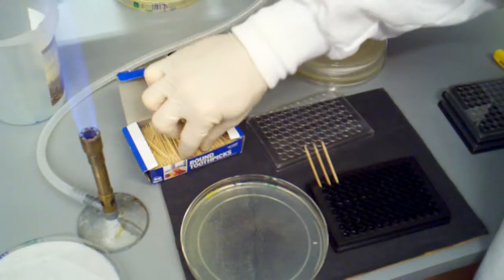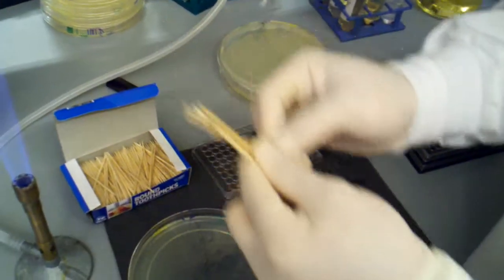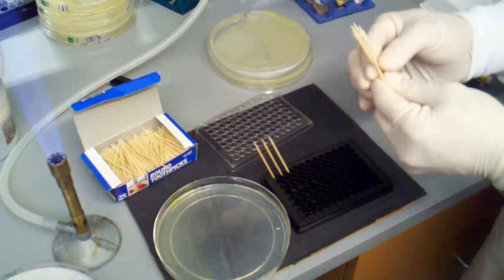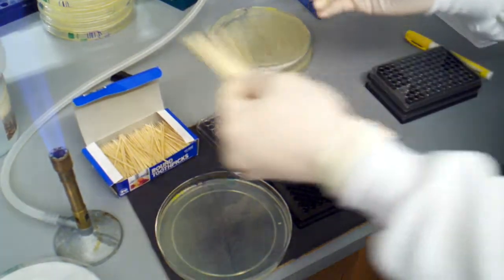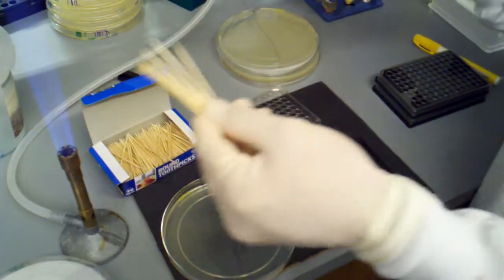If you want to go a little bit faster, what you can do is grab a few toothpicks and kind of line them all out like that. Flame them all off.